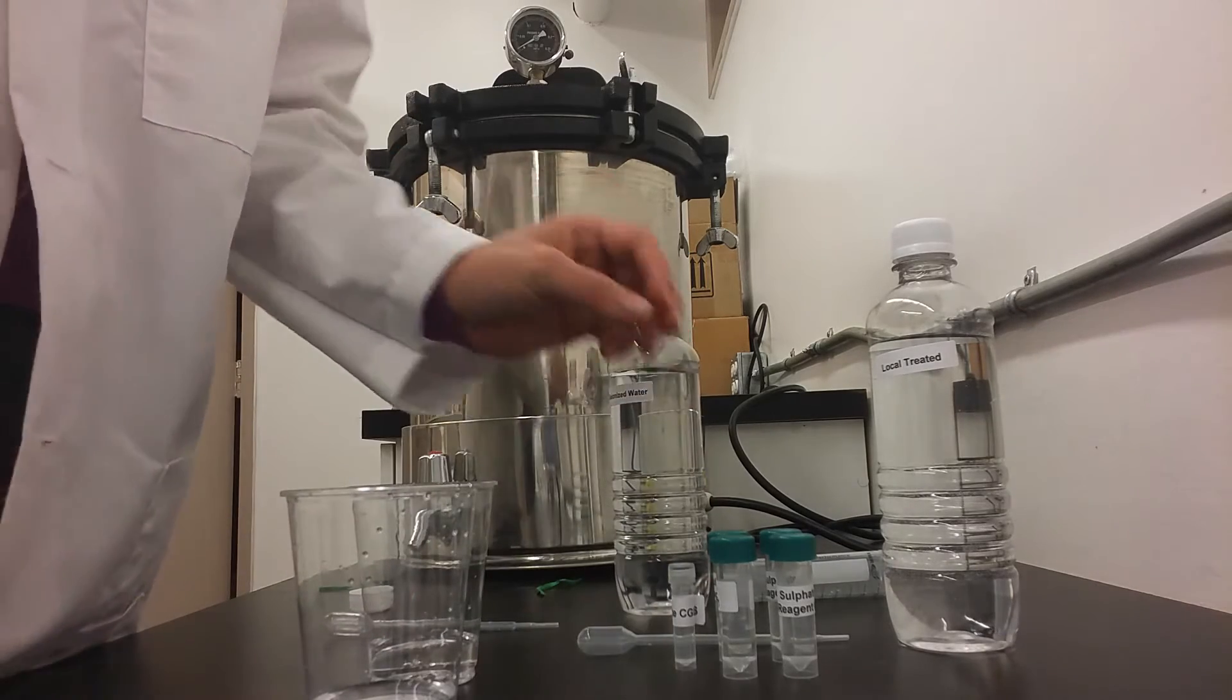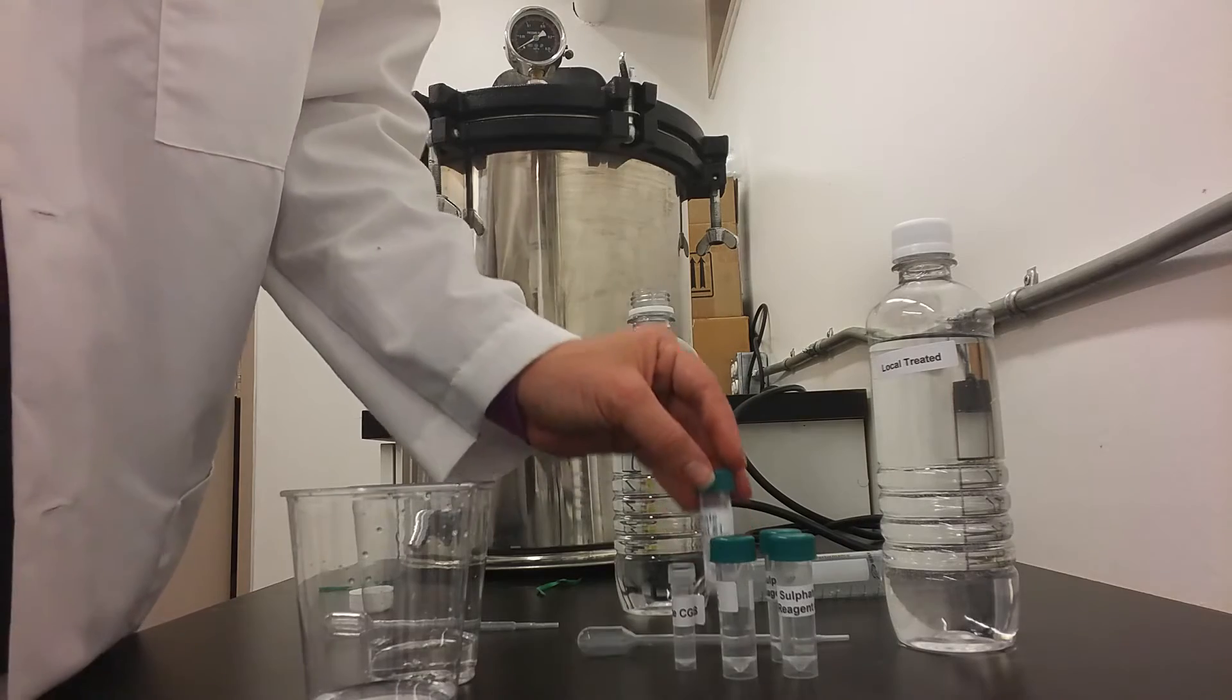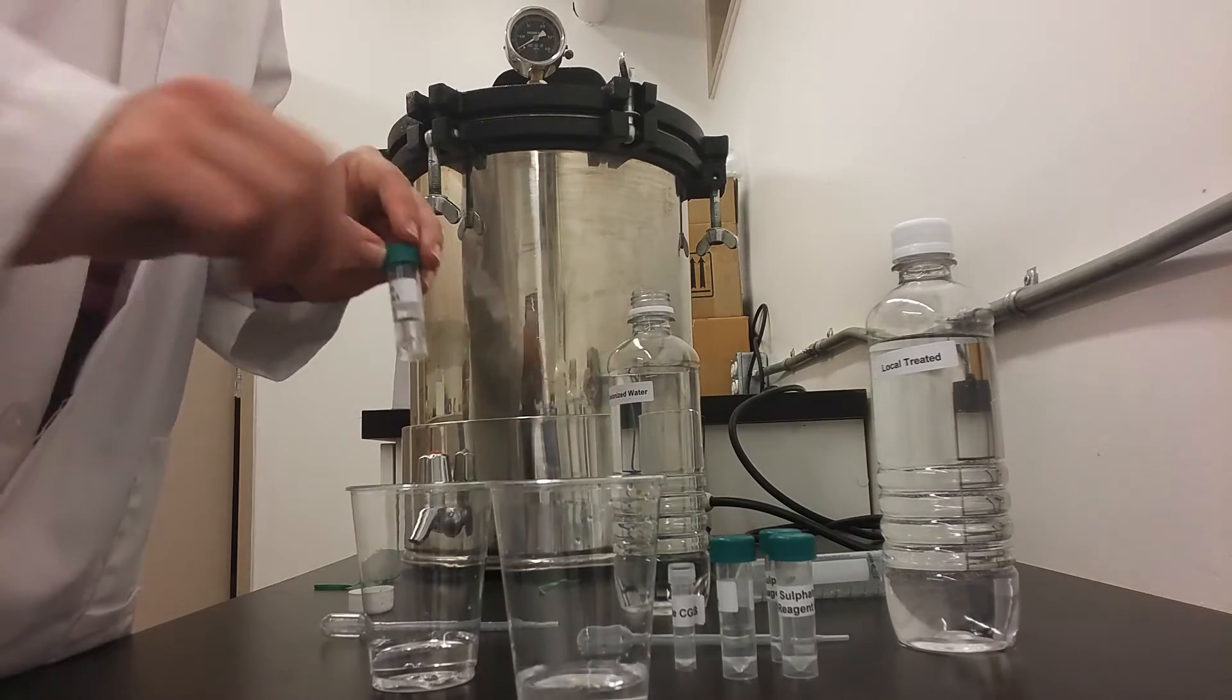Next, we will take sulfate reagent number 1 and add it to that control cup.